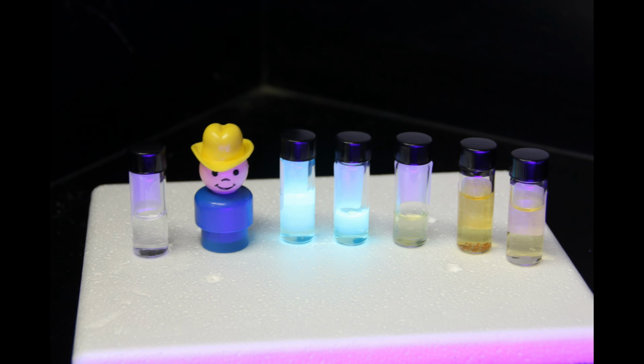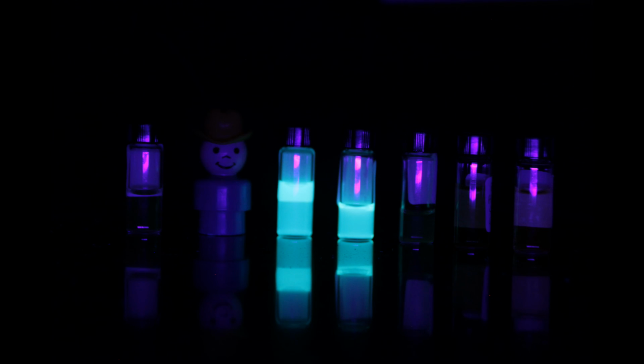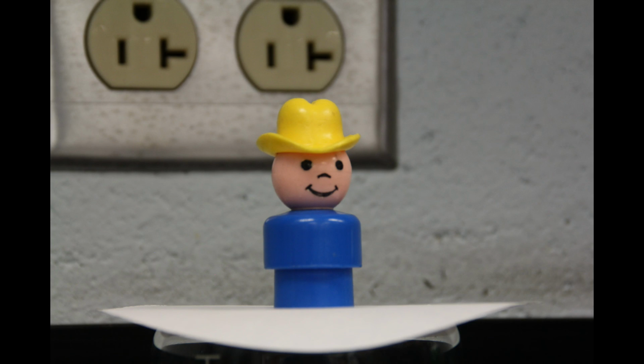That doesn't always happen. There are many different dyes that can be used to target different molecules that are important in forensic chemistry. Amines are just one type of chemical group that scientists like to target in forensic labs. That concludes today's lesson on fluorescence testing.